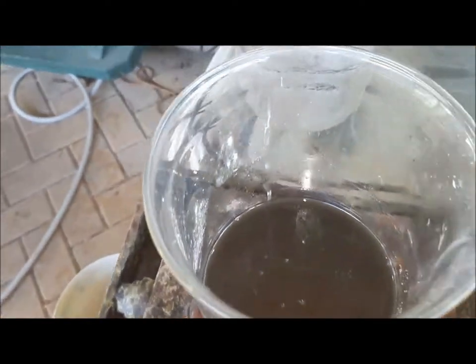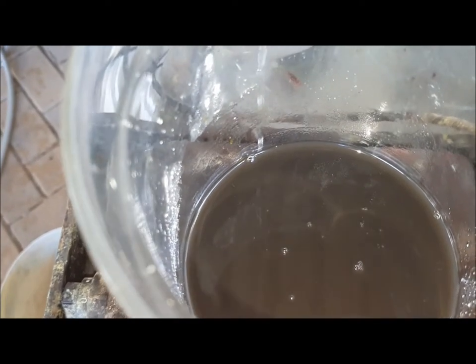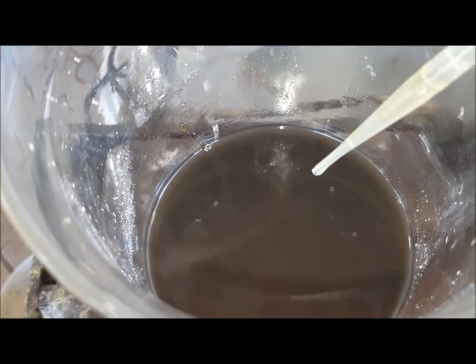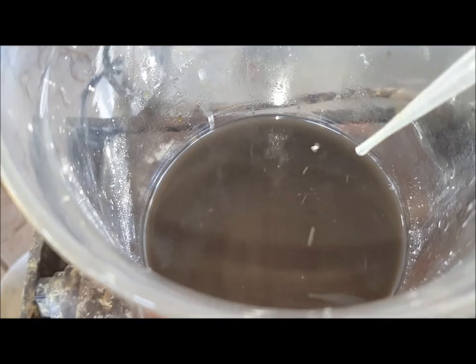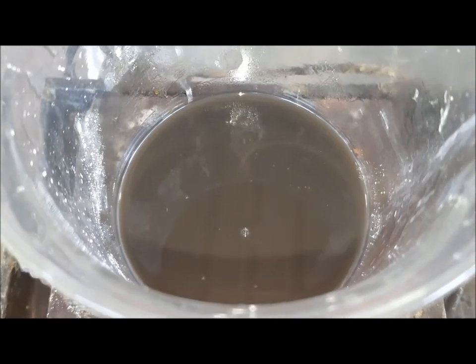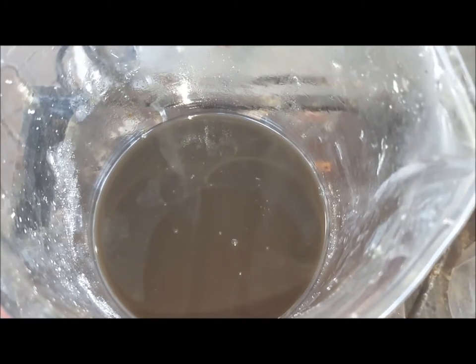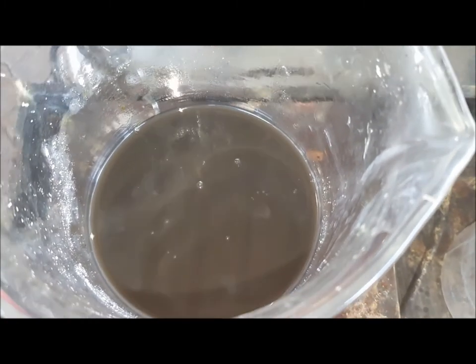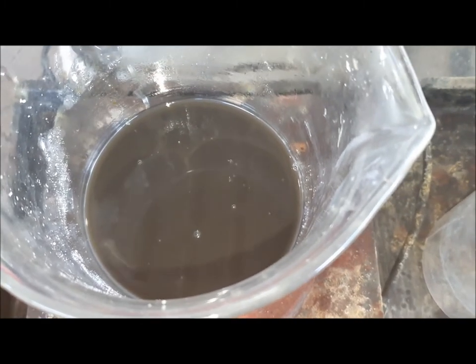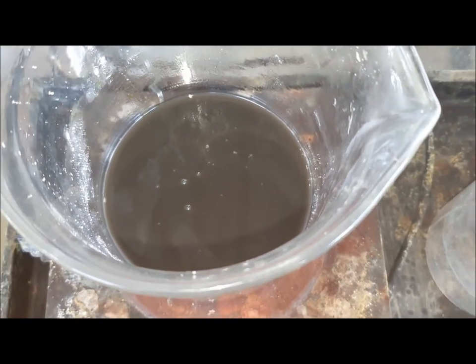I've drained all the solution out of the beaker and put some hydrochloric acid in, just enough to cover everything. Now I'm going to put about half a pipette of nitric acid — I'll need more but I'll add it later. I know I say this in every video and I'm going to keep saying it because it's important: you can't put too much nitric, otherwise if you do you'll never be able to drop the gold. So put small doses at a time.